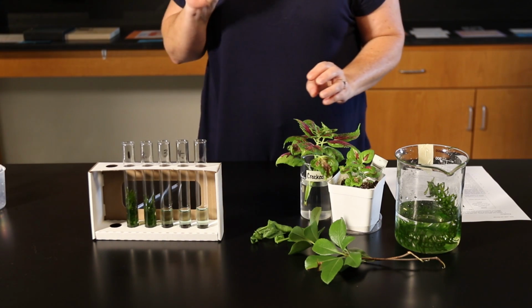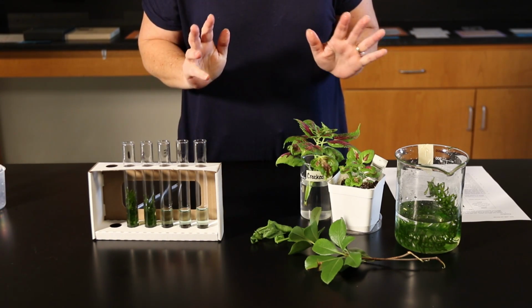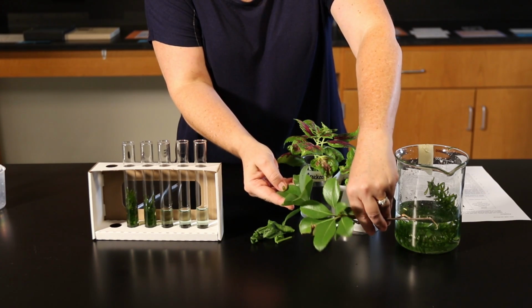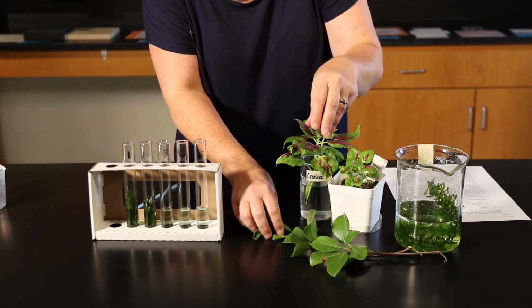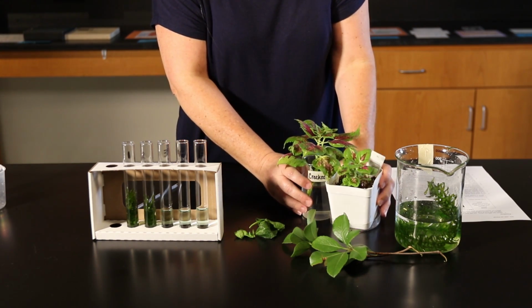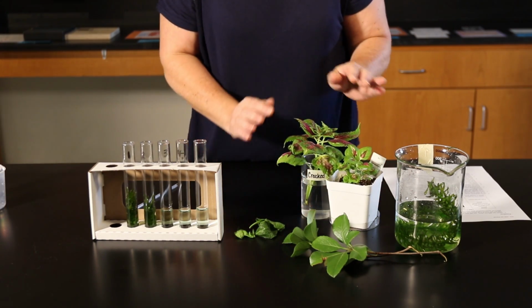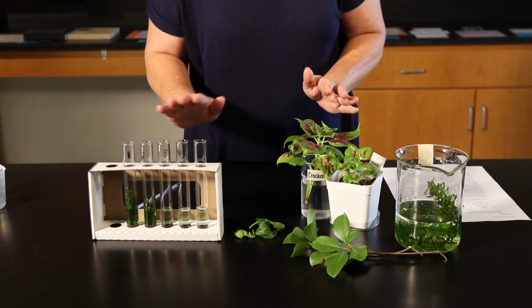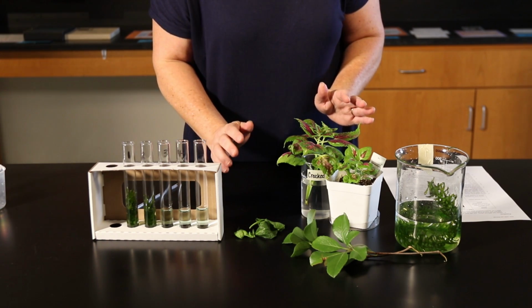Now, your second plant type can be a variety of plants. It can be plants that I picked off of bushes outside of my house. These are spinach leaves from my vegetable drawer, and this is just a common household plant. As long as you have 2 healthy leaves, this is for test tubes 3 and 4, it should be fine.